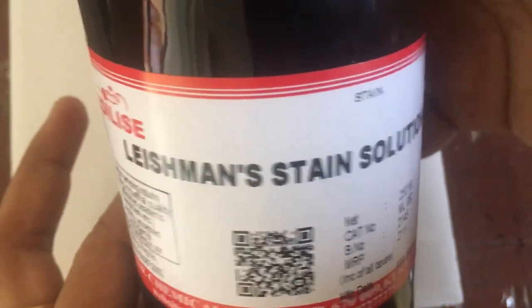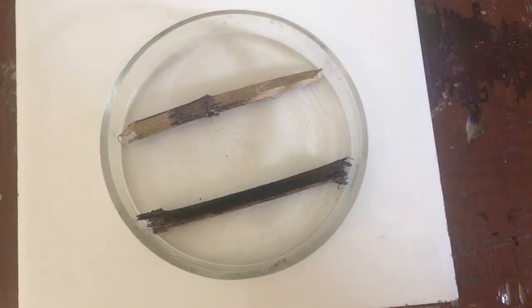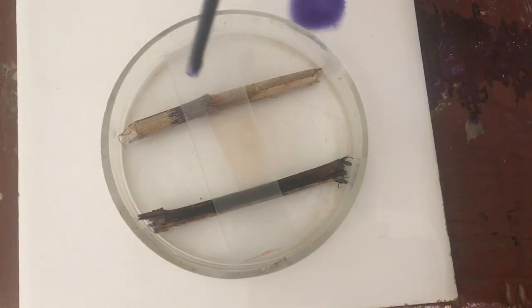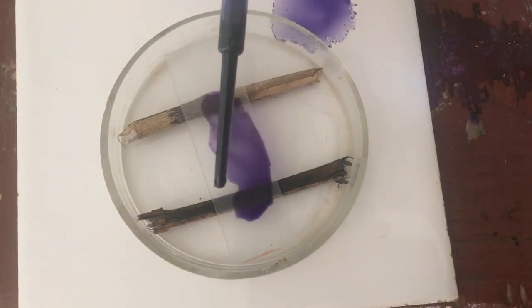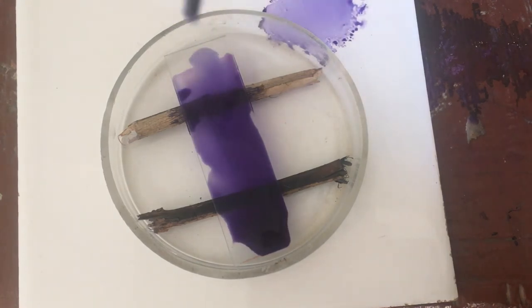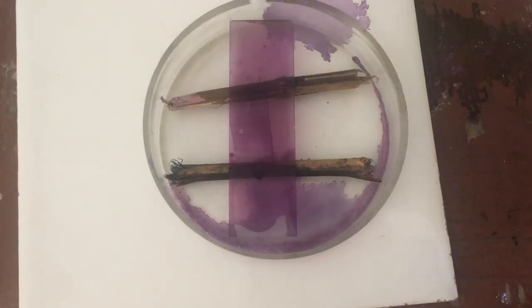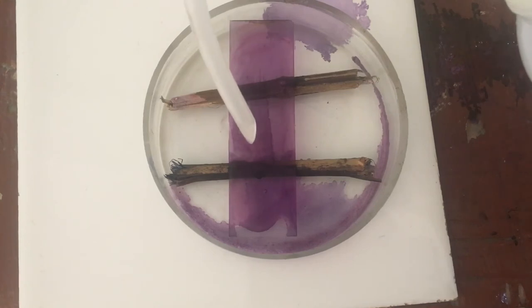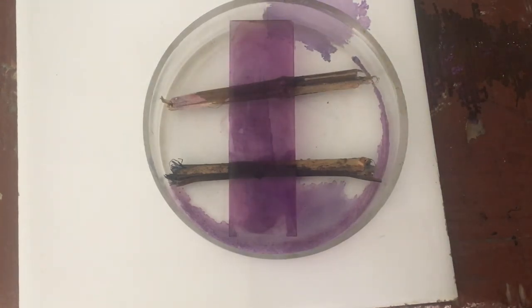Next we need to stain it. We are using Leishman stain. Keep the slide in a petri dish for convenience, then add the stain — add enough so that it covers the entire surface of the slide. Wait for four minutes — this is very important. After four minutes, dilute the stain by adding double the amount of distilled water. Then wait correctly for 10 minutes.